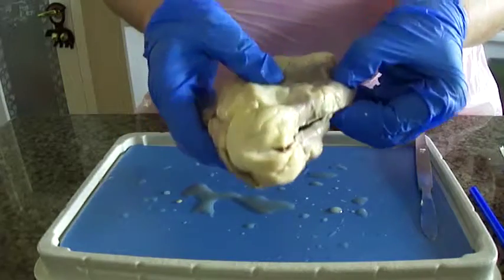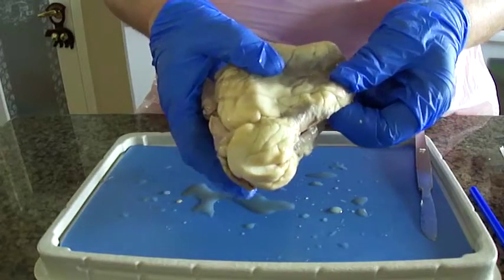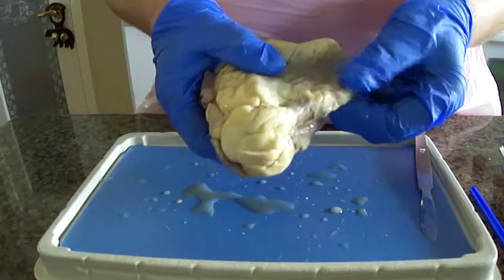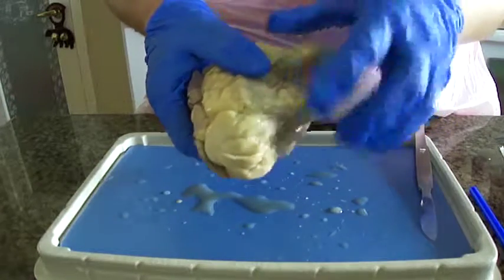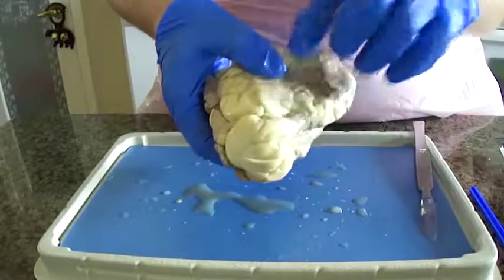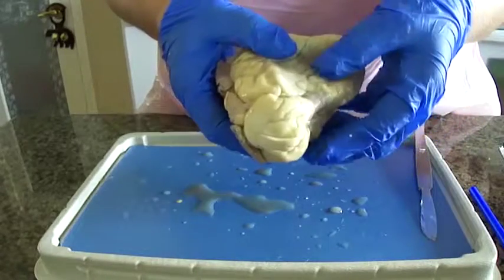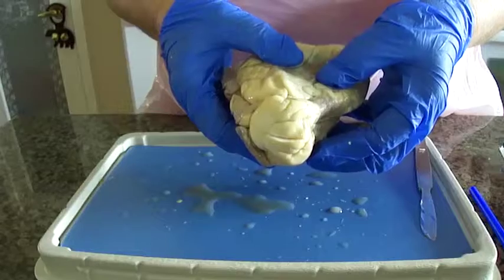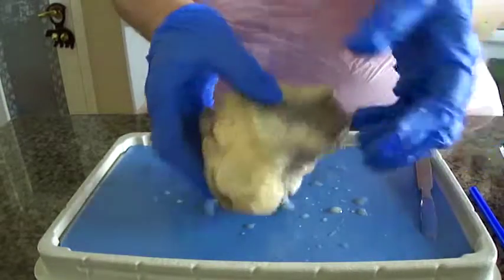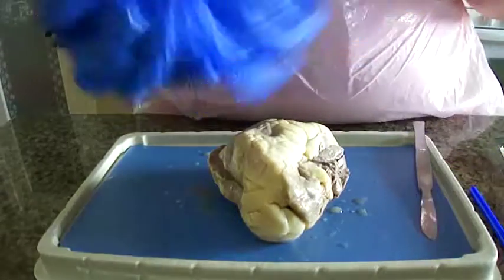The right auricle is the same thing, the darker tissue, and it's a flap, and it's a small projection from the right atrium of the heart. The right ventricle is a triangular shape and extends from the right atrium to near the apex, and its function is to receive deoxygenated blood from the right atrium through the tricuspid valve and pump it into the pulmonary artery. And that is it for the exterior portion of the sheep heart.